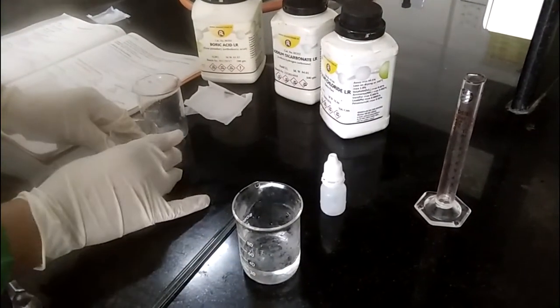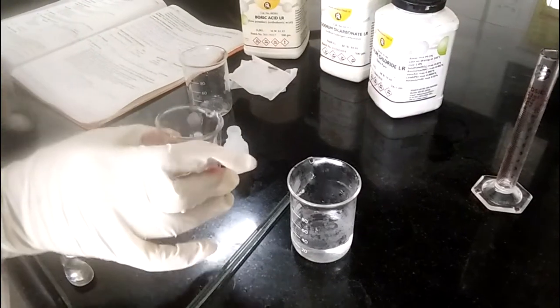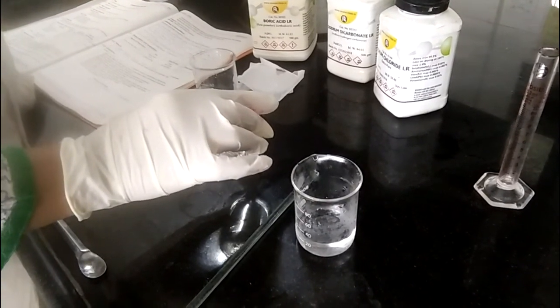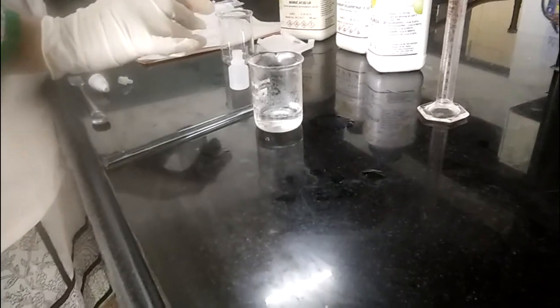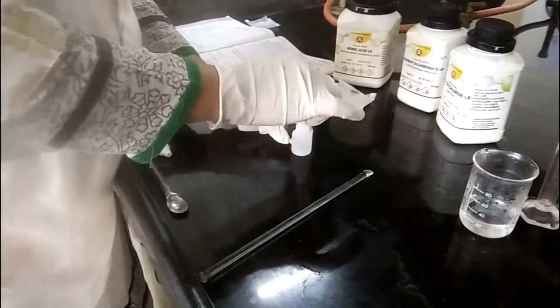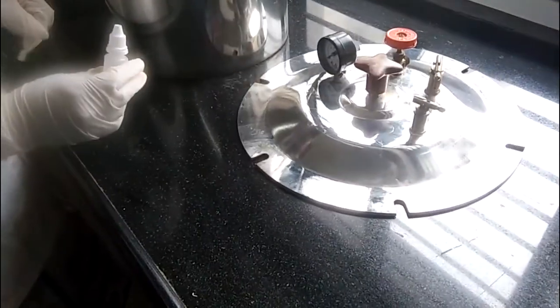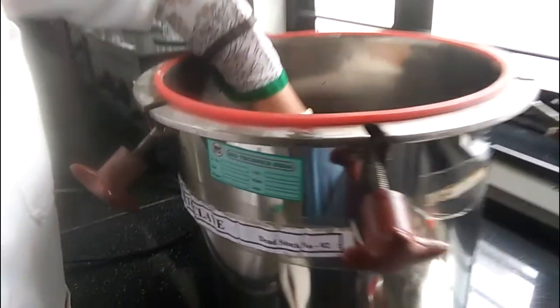Filter if necessary, but there is no need for filtration here as the solution is clear. Transfer the solution into the final container, pour the solution, and place the cap over it.